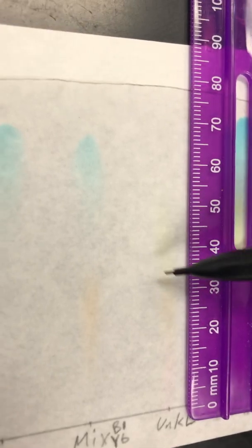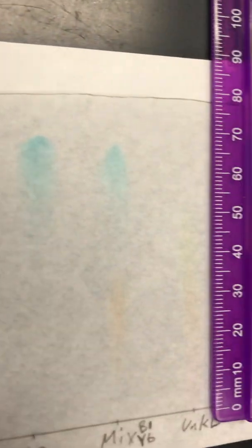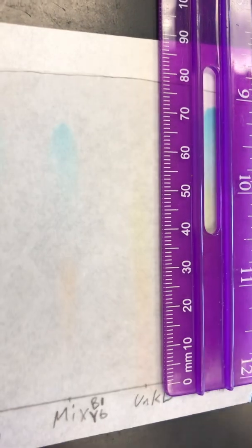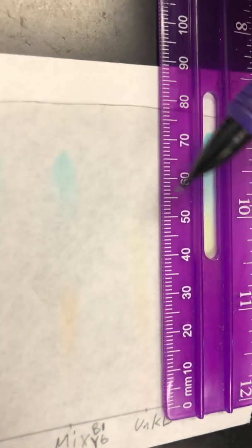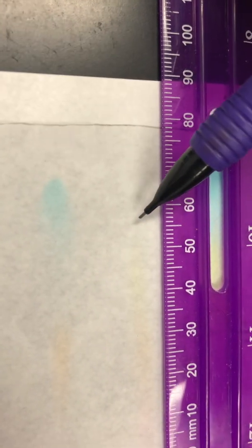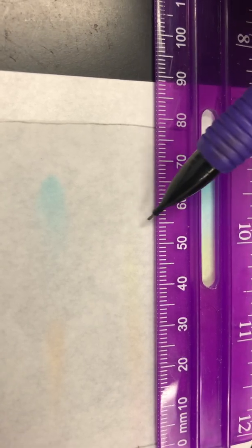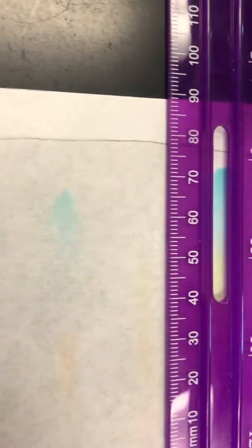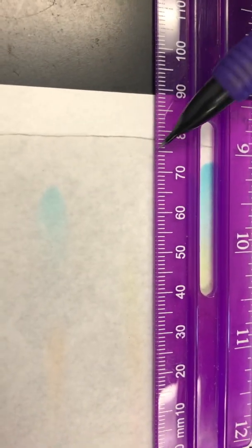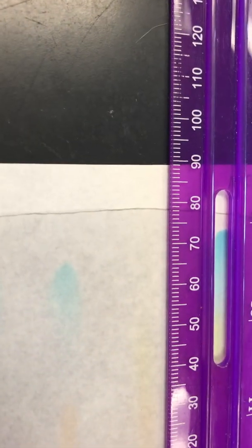Okay, your next color is around here, so probably about there. You can measure that one. Okay, and then your next color stops about right here. It's a little trickier to see, but about right here. A little harder to see on the camera. And then here's your D solvent. And remember, the D solvent is going to be the same for all 3 of the spots that are in your unknown B.